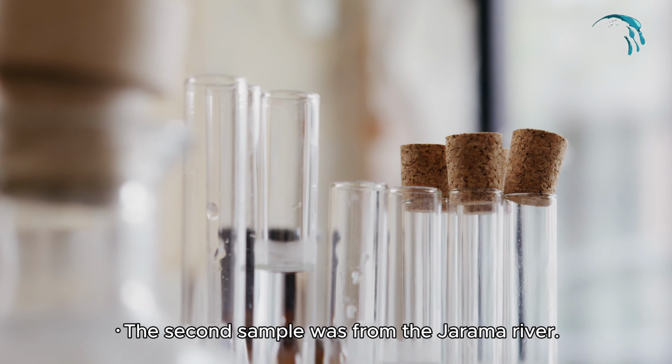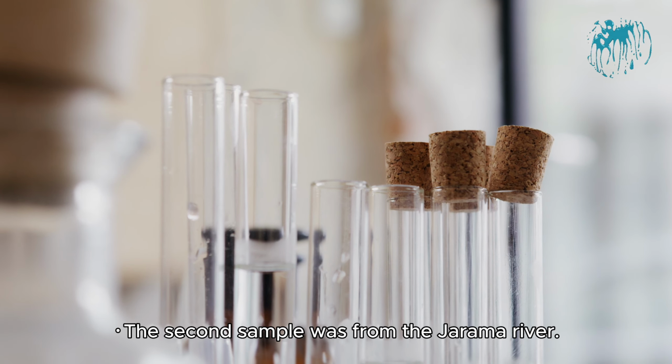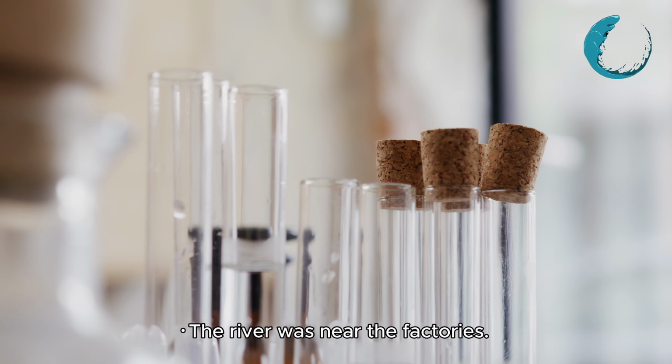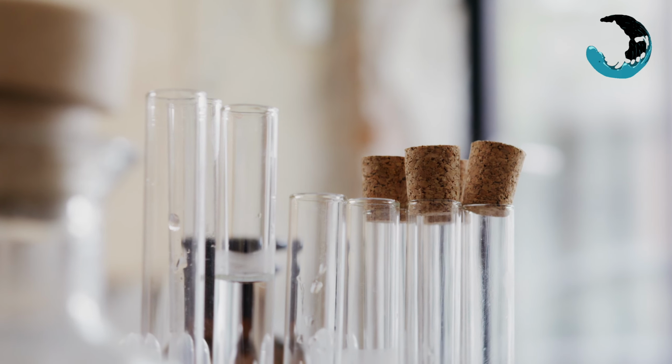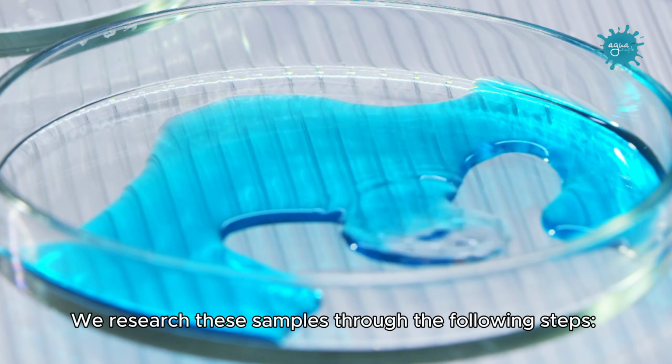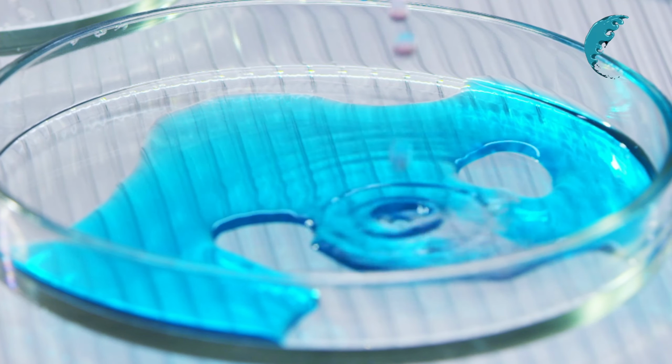The second sample was from the Jarama river. The river was near the factories. The third sample was from the pond in the APAMA orchard. We researched these samples through the following steps.